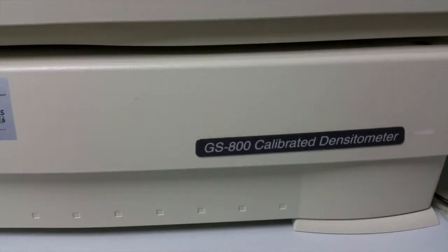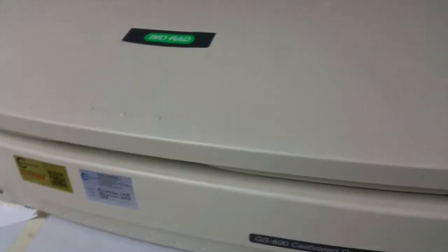What you're looking at is the densitometer, model GS-800 calibrated densitometer, a product of Bio-Rad. First of all, you have to have a computer attached to it. Turn on the computer first and start the machine so the machine will warm up. Let it warm up a little bit.